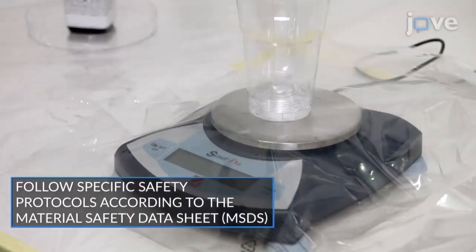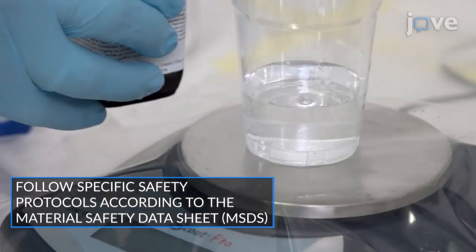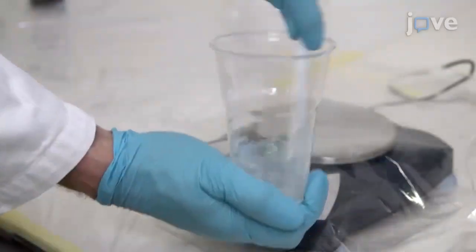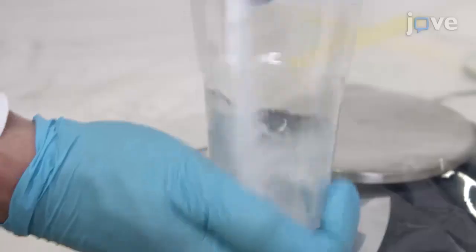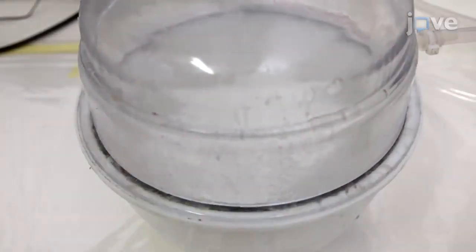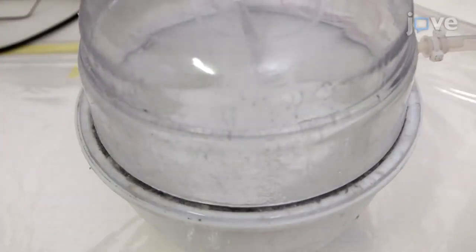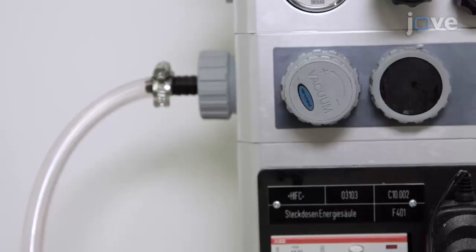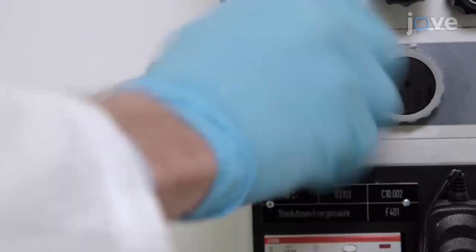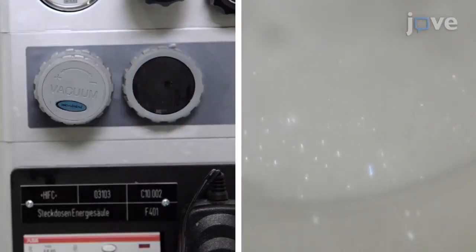Prepare a PDMS mixture by combining the elastomer with its curing agent at a 10:1 ratio in a 40 milliliter beaker. With a plastic knife, mix vigorously until the liquid is homogeneous. Immediately degas the PDMS mixture in a vacuum chamber for 45 minutes at room temperature. To expedite the process, periodically release the vacuum in order to burst the bubbles that form at the interface.